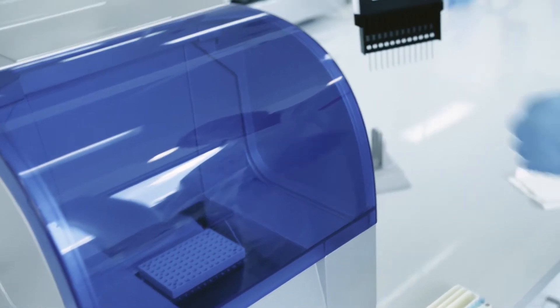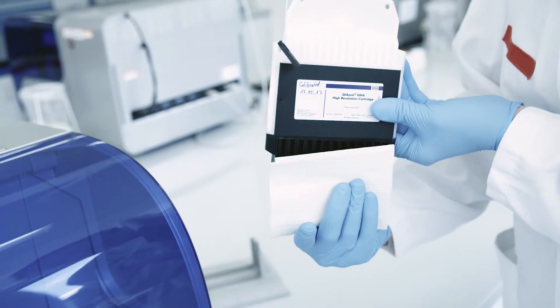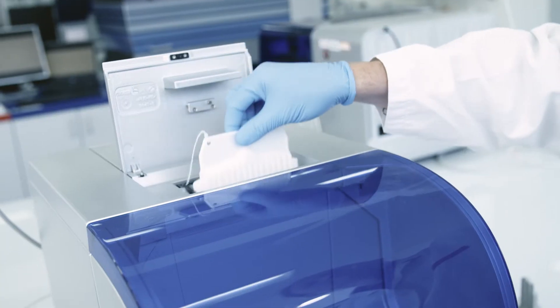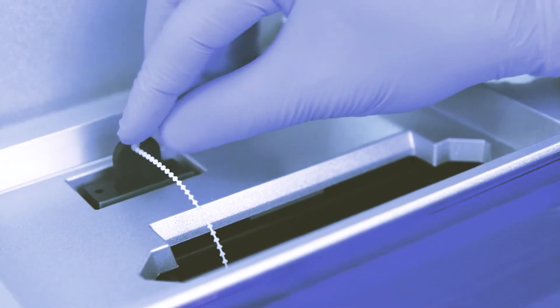After the incubation, clean the capillaries and purge port before inserting the cartridge and smart key into the instrument.